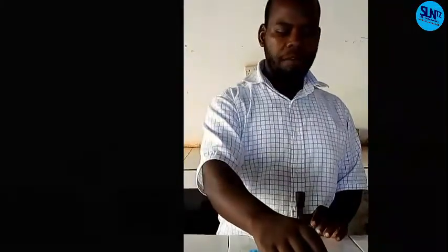And then I have a sheet. This is a qualitative guide sheet. After observation, I will show you how to write a report according to the observations. I will write a report on experiment, observation, and the inference. I think we are together. Let's proceed with our lesson.